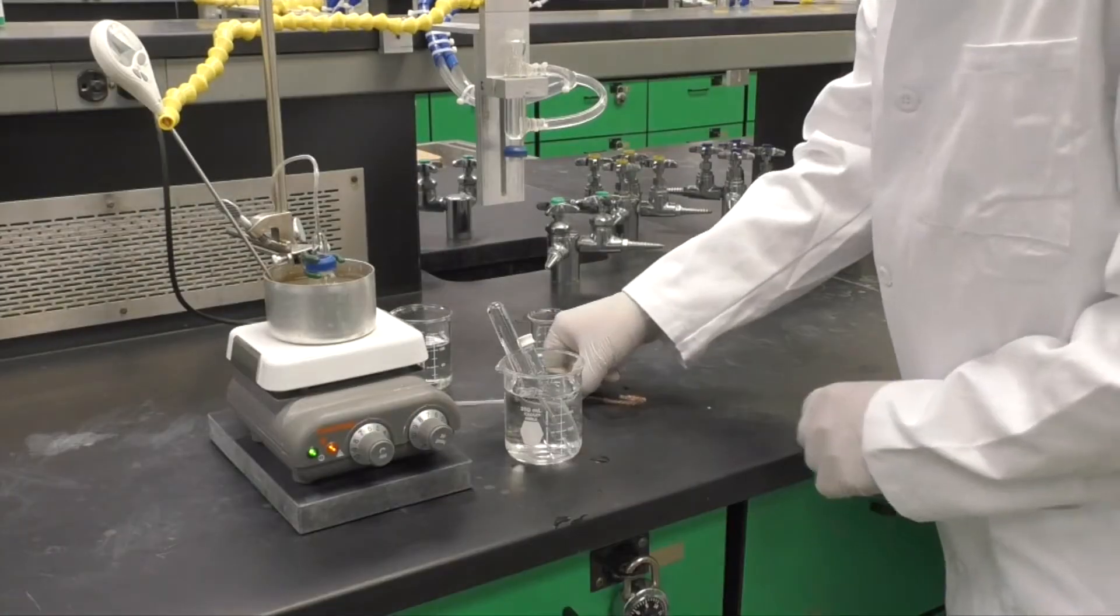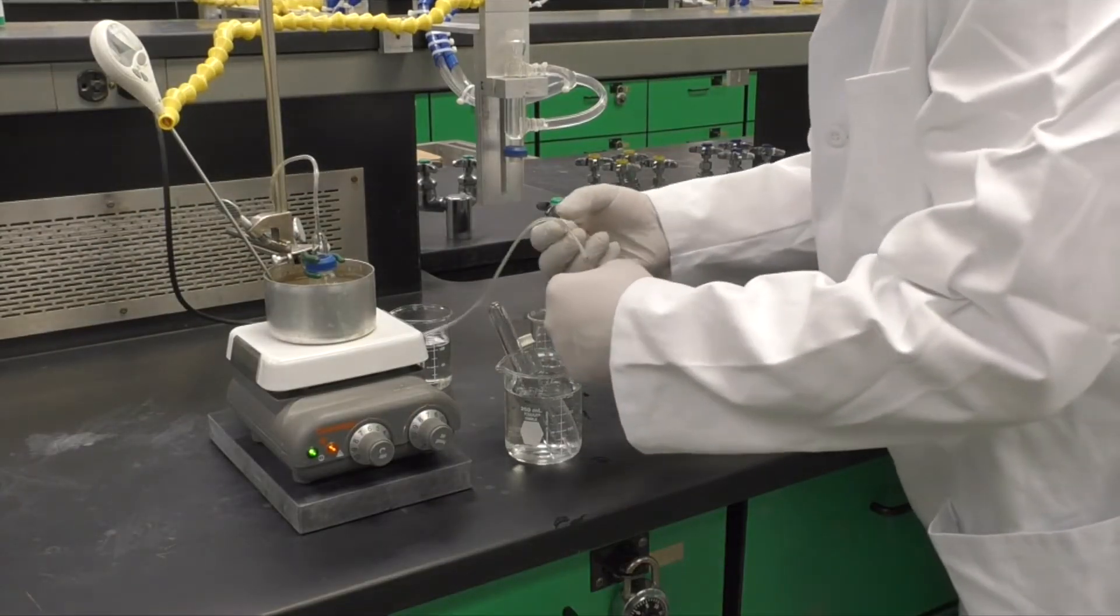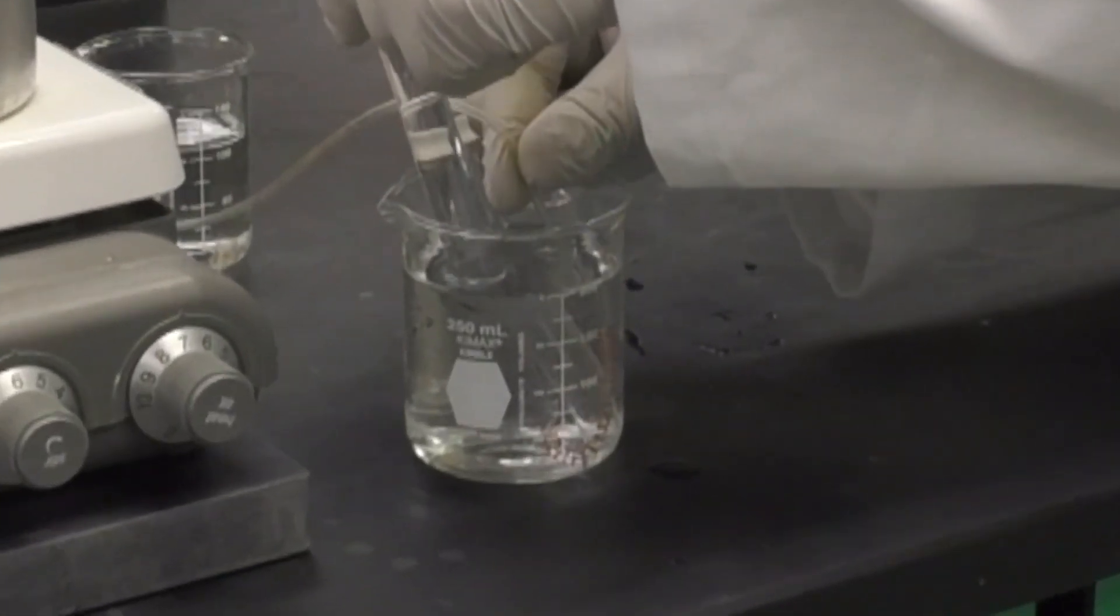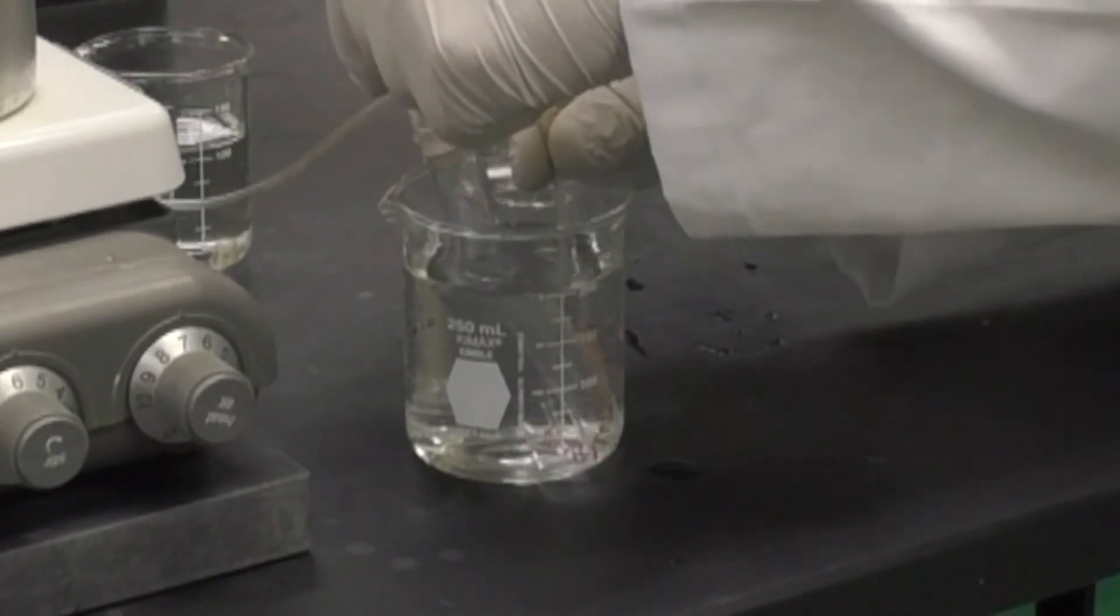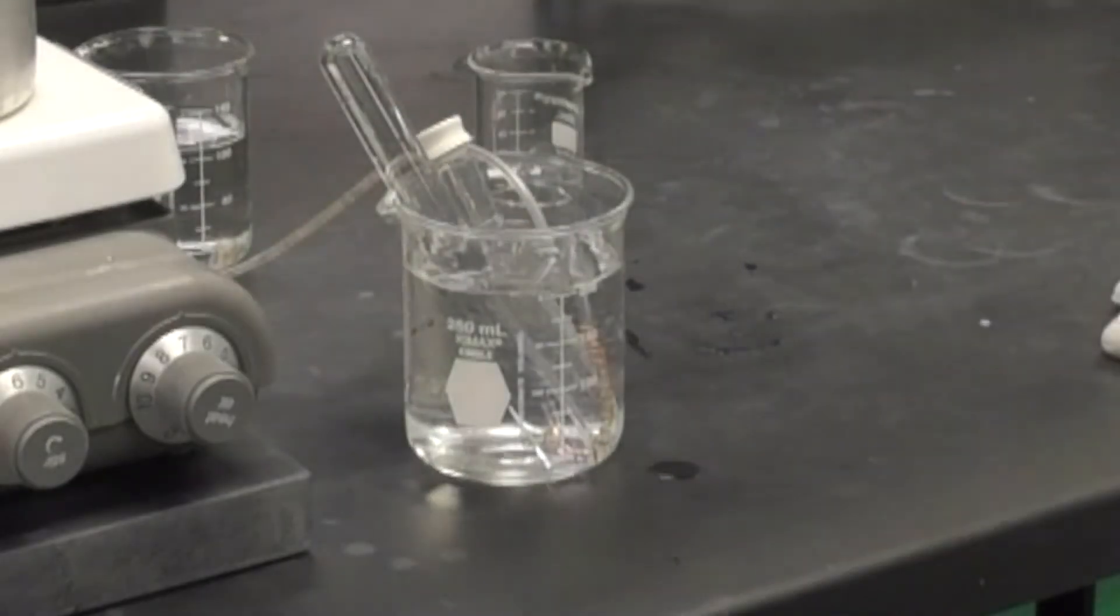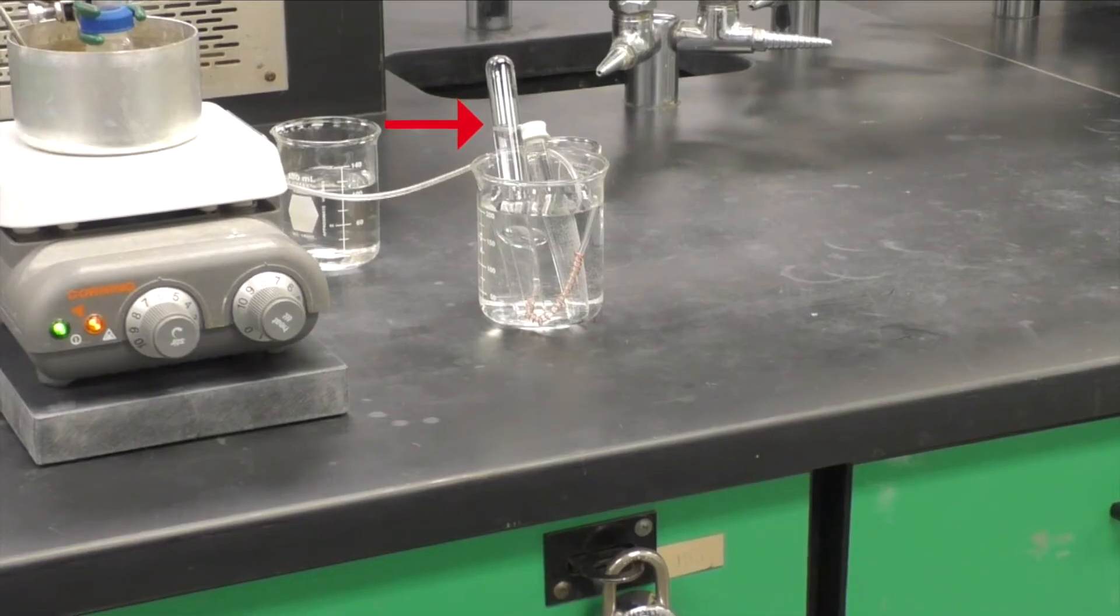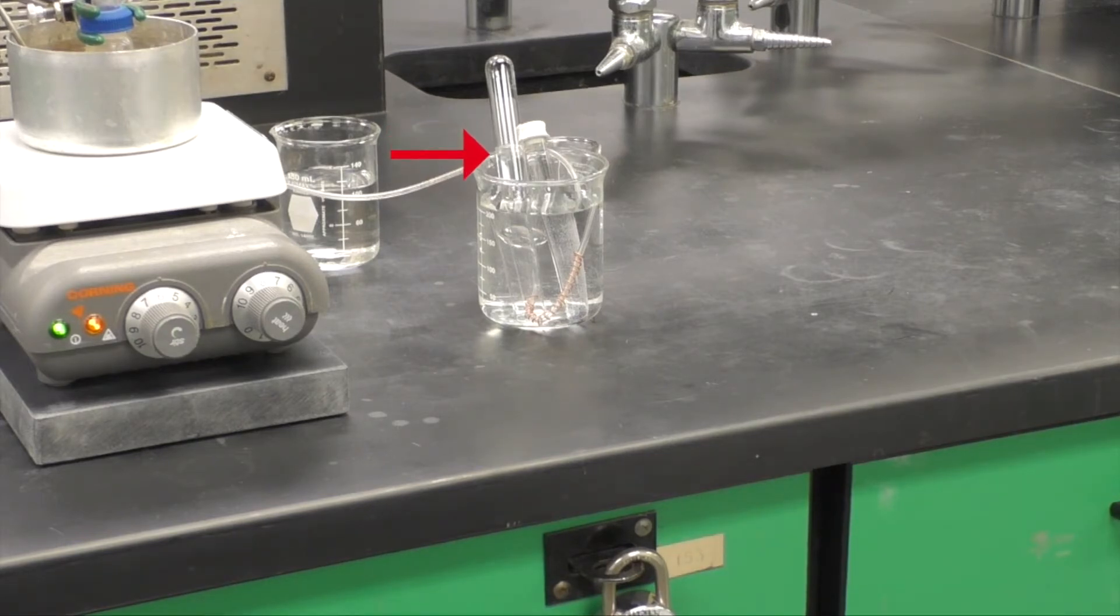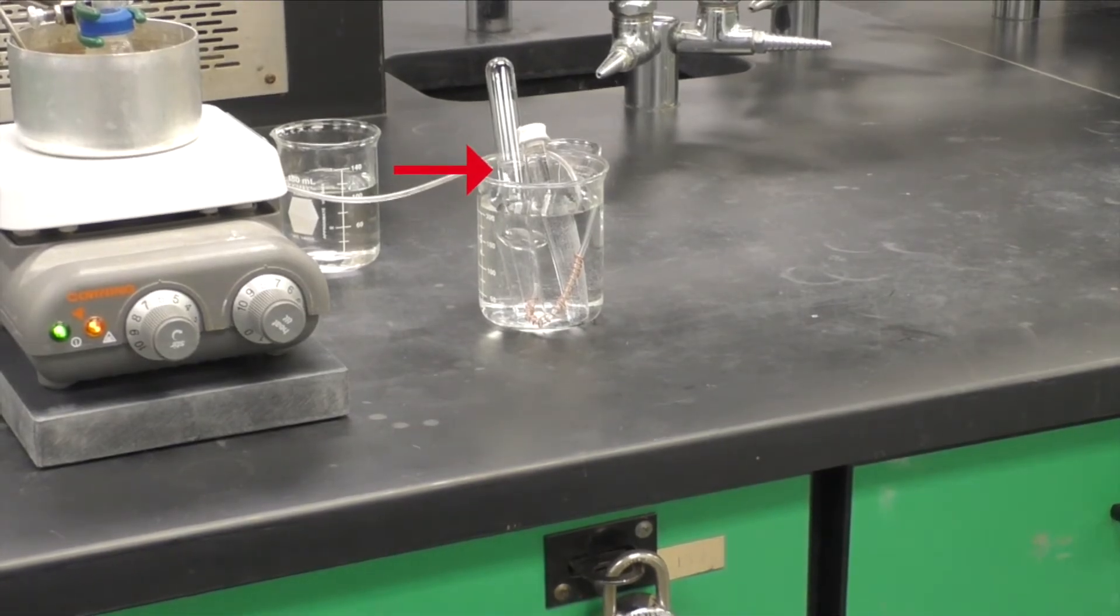To place the copper-wrapped end of the tubing, carefully lift up the 6-inch test tube just high enough to slip the Tygon tubing into the open end. When the reaction reaches about 80 degrees centigrade, you'll see bubbles coming out of the tubing and displacing the water in the 6-inch test tube.